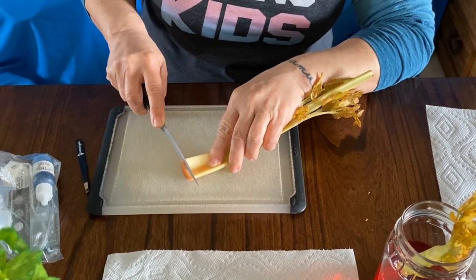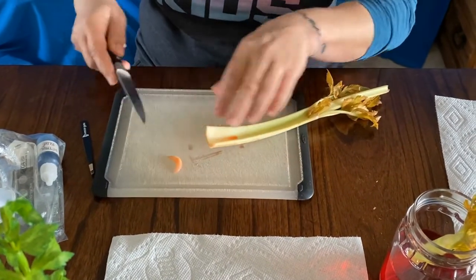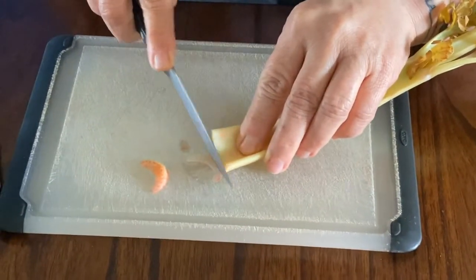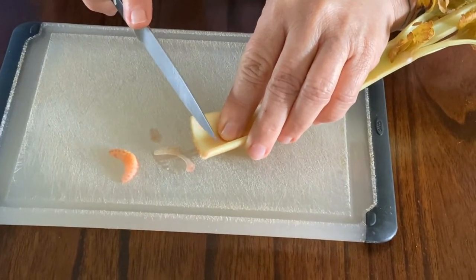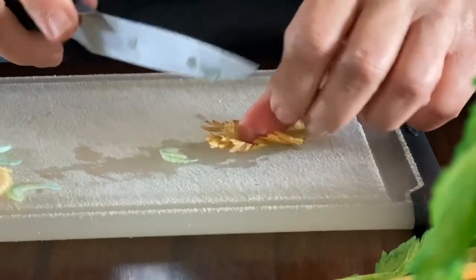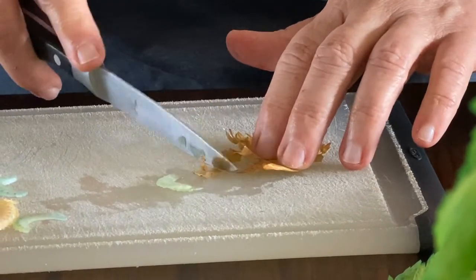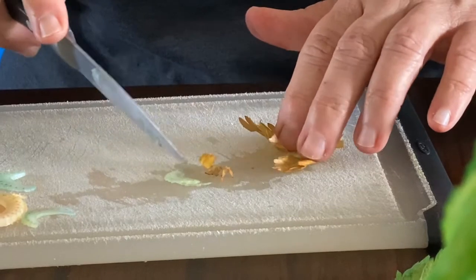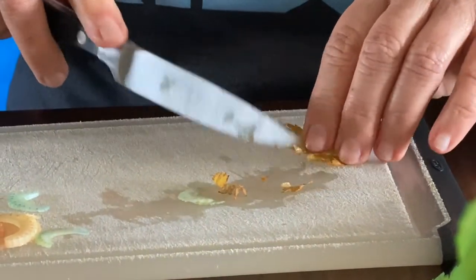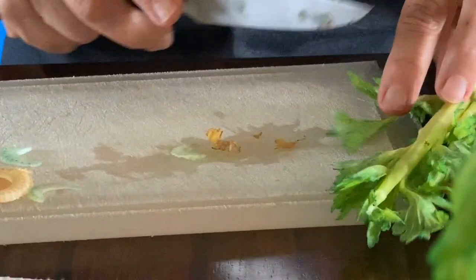In class, I have this little razor blade that I use to get really, really thin slices, so I don't know how talented I am with this great big giant knife. I'll try to, there we go, try to get some really thin slices. For the leaves, we'll just take a little section of each. And when we prepare the slide, we'll put a little bit of water on it and put a cover slip on it so that we can see it nice and close and flat.